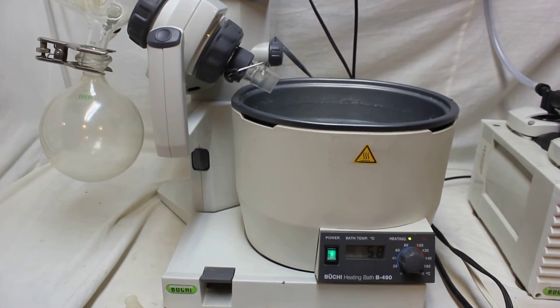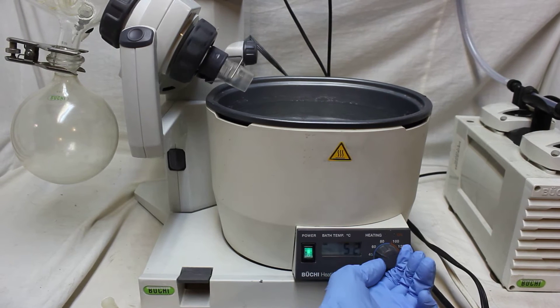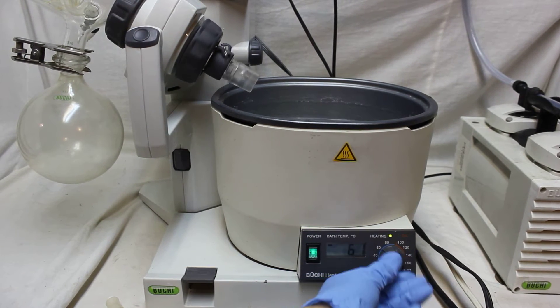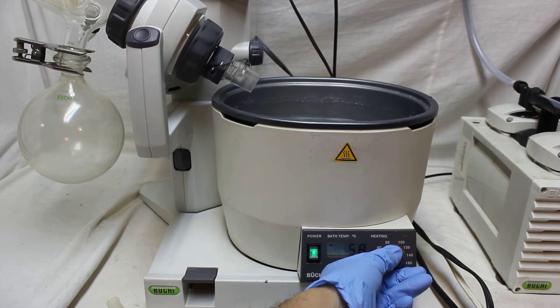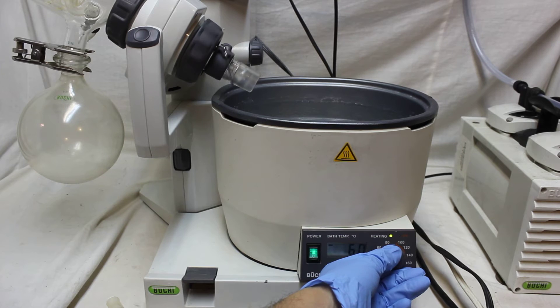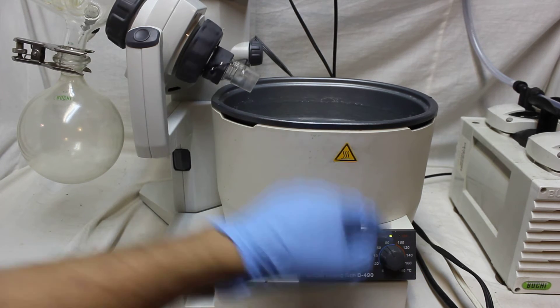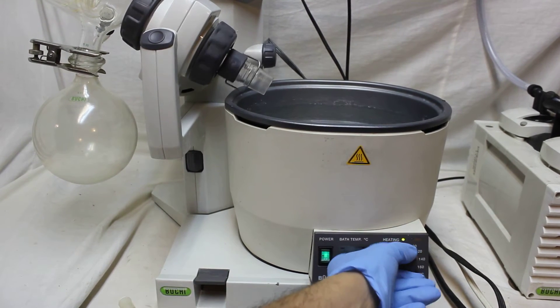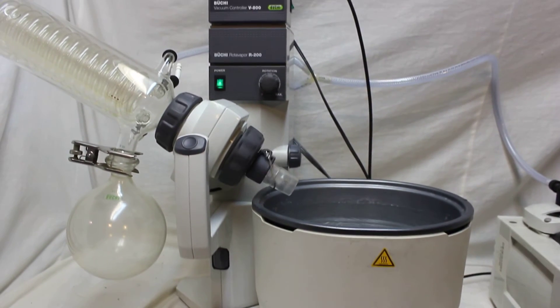Now the only thing left to see is if the water bath is working. The temperature shows below 60. If you increase to 80, it starts heating. I can see it just heated, so everything is working fine.